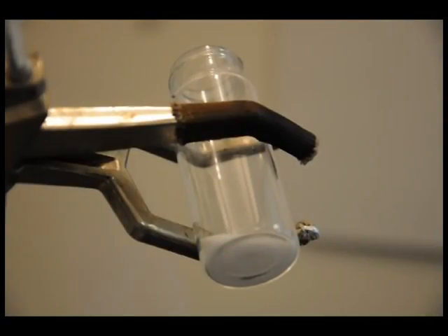We begin by melting the potassium chlorate in the glass container using the Bunsen burner. This may take a minute or two.